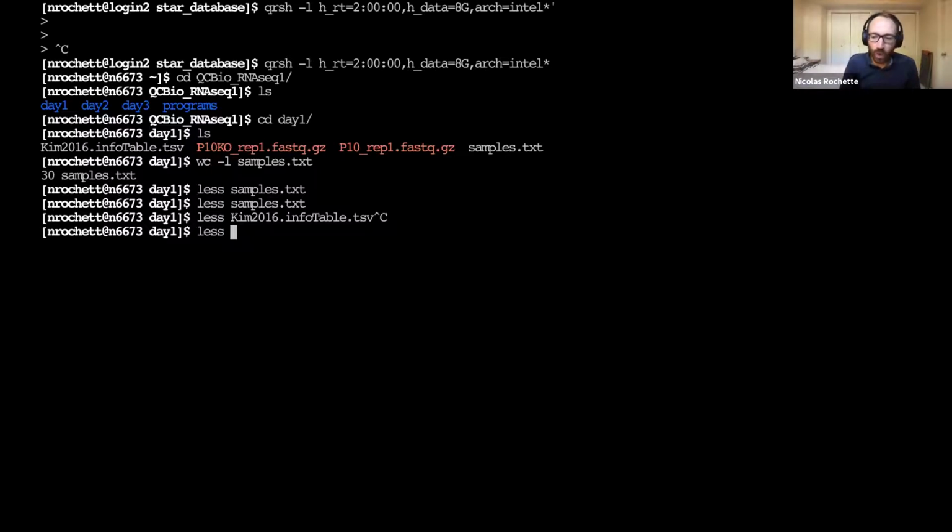The second way to not introduce typos is to use tab completion, so auto completion. And so here I can just write less and then Kim, and then I want to complete the 2016 info table.tsv name. I can just hit tab and it's going to complete the name. And for instance, if I had made a typo in what I had already typed, and let's say I replaced the 6 by the 5, and then I'm hitting tab, it doesn't do anything because there's a typo, so there's no matching file.